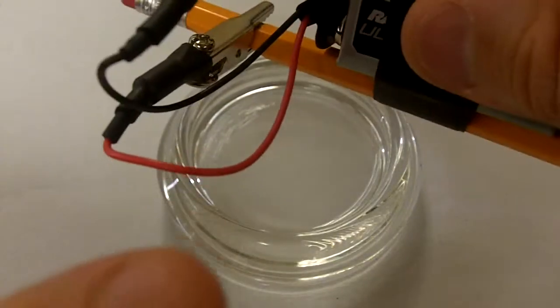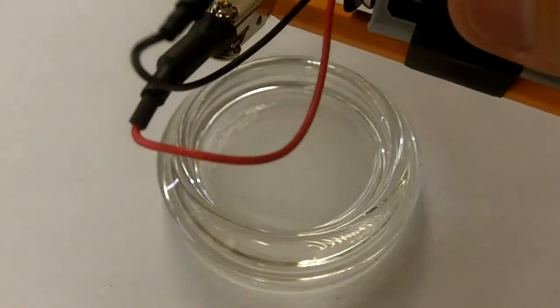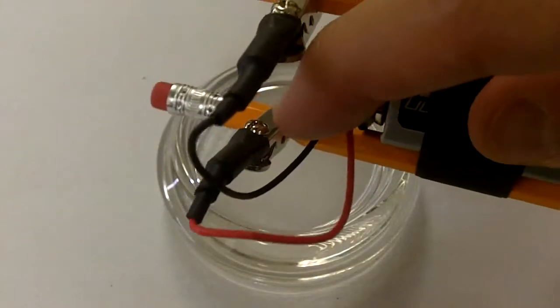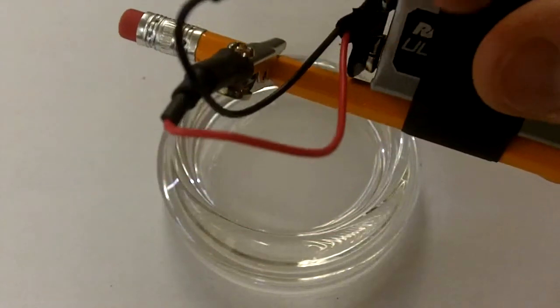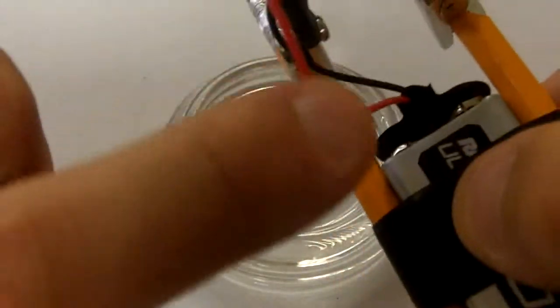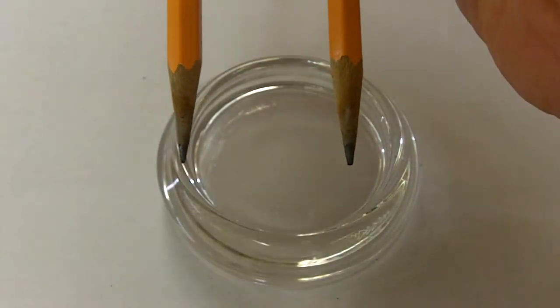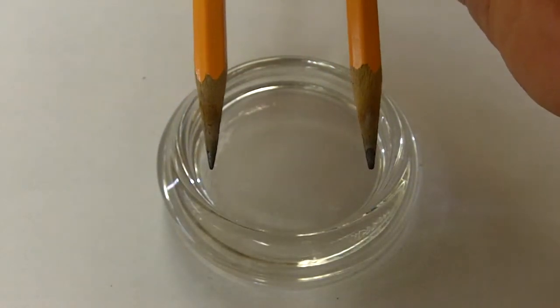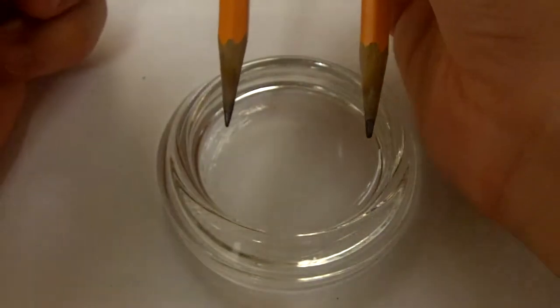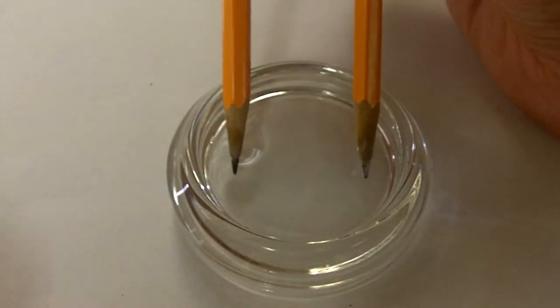Two sharpened pencil lead tips on each pencil there. We also have the red wire. The red wire indicates the anode. The other one, the black wire, indicates the cathode. So, like the data table, I'll hold the anode, the one attached to the red wire, on the left, and the cathode will be on the right to match the data table so we can better get our observations in there. So trial 1 has us test the magnesium sulfate. So I'll put both pencil leads into the solution.